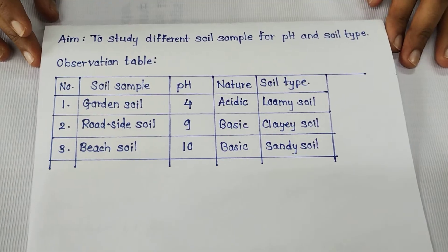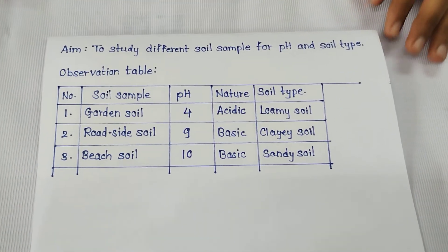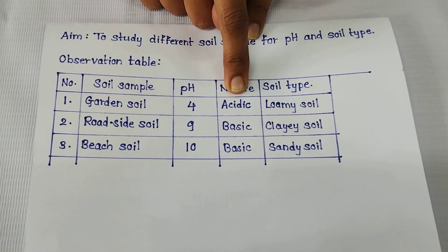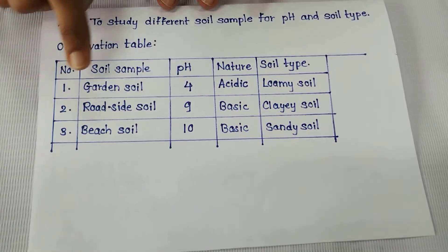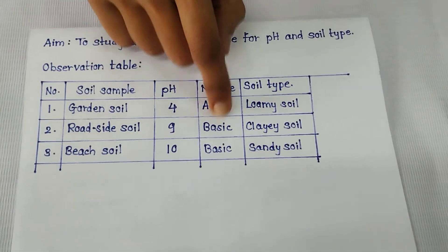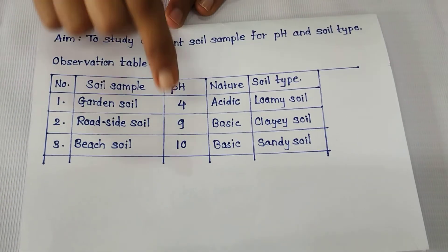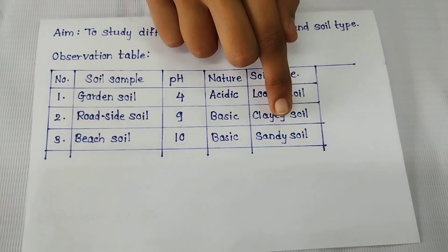The observation table of the soil sample is given. First, garden soil: the pH is 4, the nature is acidic, and the soil type is loamy. Second, roadside soil: the pH is 9, the nature is basic, and the soil type is clayey. Third, beach soil: the pH is 10, the nature is basic, and the soil type is sandy soil.